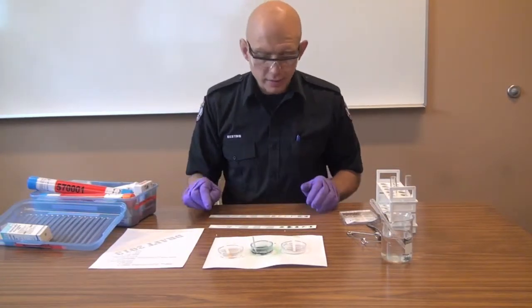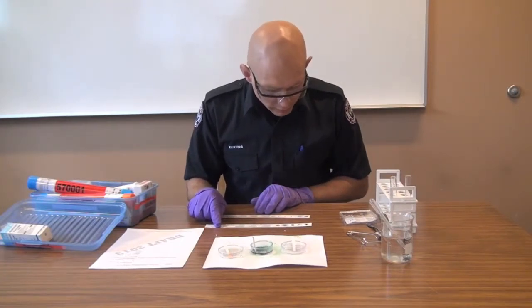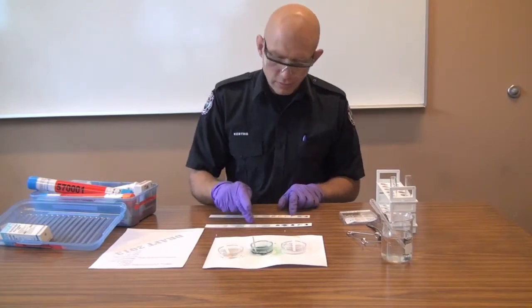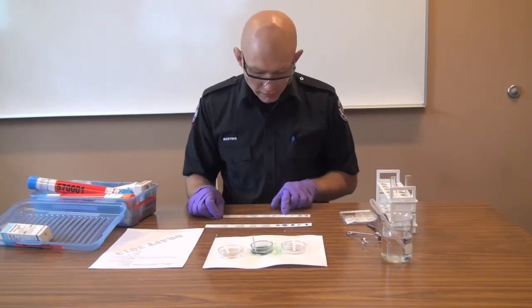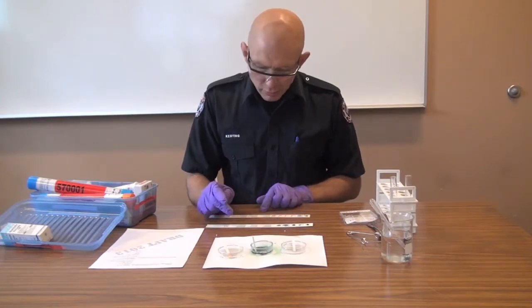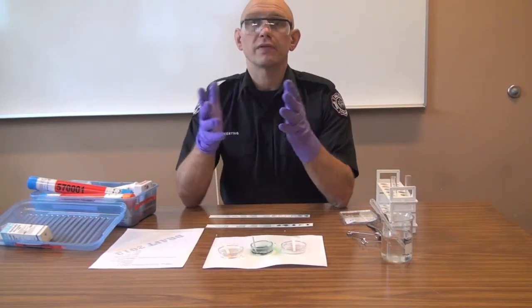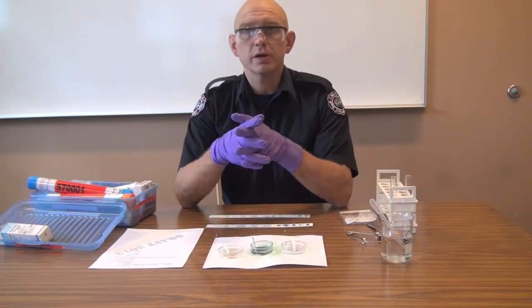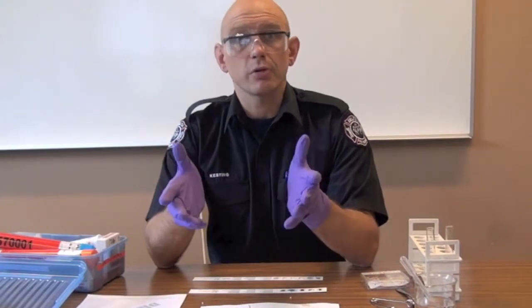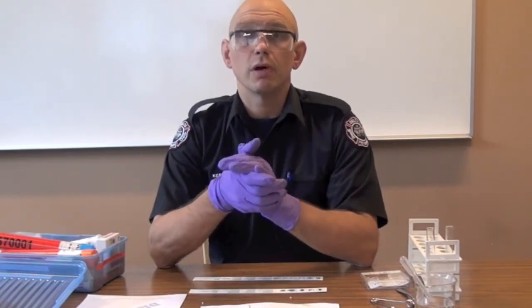You're going to write down the color change. Is it an acid or a base? As a matter of fact, both of these test out to be strong bases. Is it an oxidizer? Neither of these that I tested were oxidizers. Is there a hydrogen sulfide risk? Is there a fluoride risk? No and no respectively. Is there a nitrate risk or a petroleum product risk? No. Iodine, bromine, or chlorine? Or nitrate? No and no. So we've managed to narrow down our field of options considerably and we know more information about it. Maybe this is where we stop — or maybe it isn't. If we've been properly trained and if it's appropriate, we can go on to the next step, which is the really fun one where we actually try to burn this stuff and figure out a bit more about it.